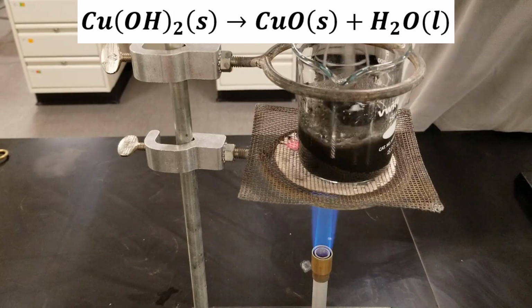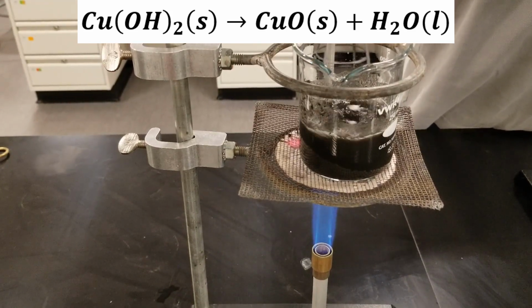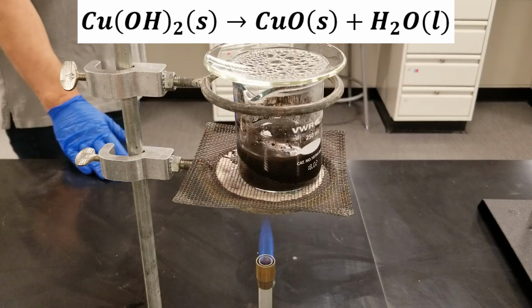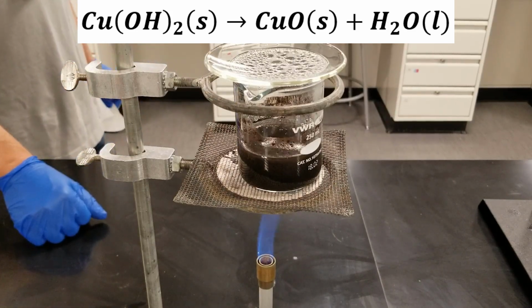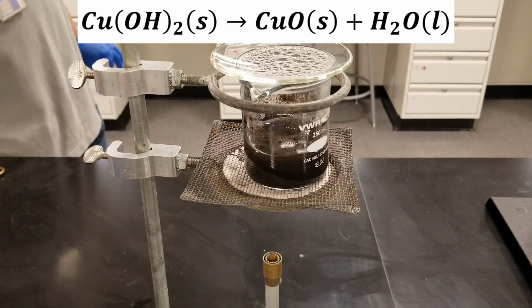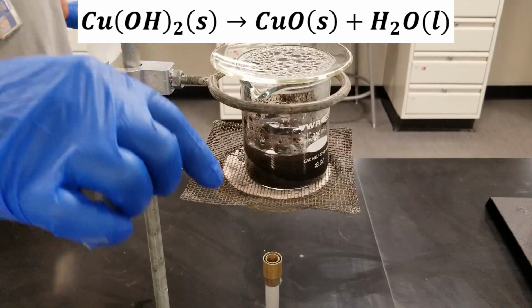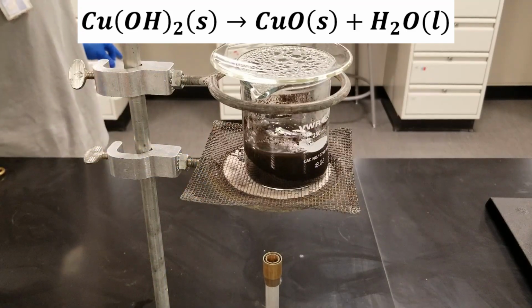Okay, and you can see it's been heating up a little bit longer. It's turning into a black precipitate as opposed to a blue precipitate. Okay, that's our solution of copper oxide. I'm going to turn it off, and what you'll see is the copper oxide is a much more dense precipitate. So within a few minutes we should have a nice layer of black on the bottom and nice clear water on the top.